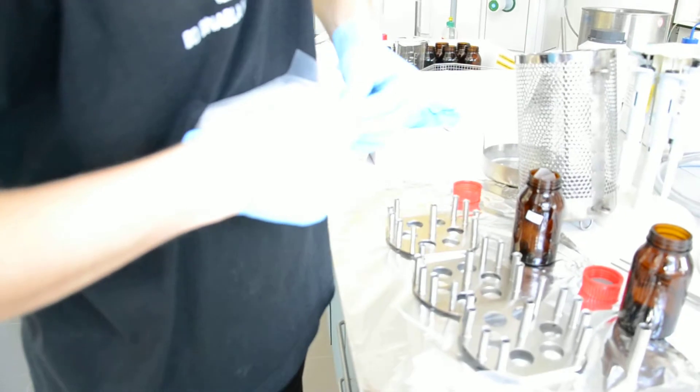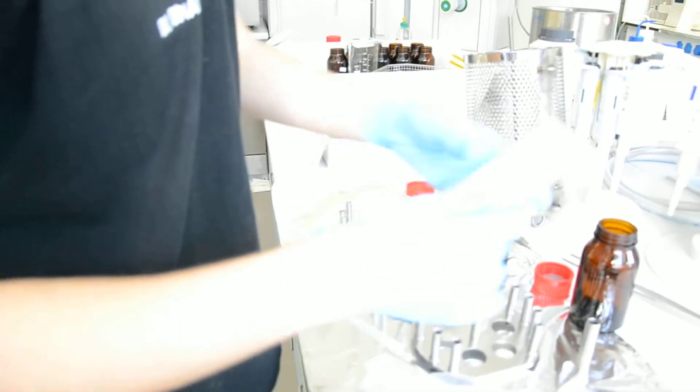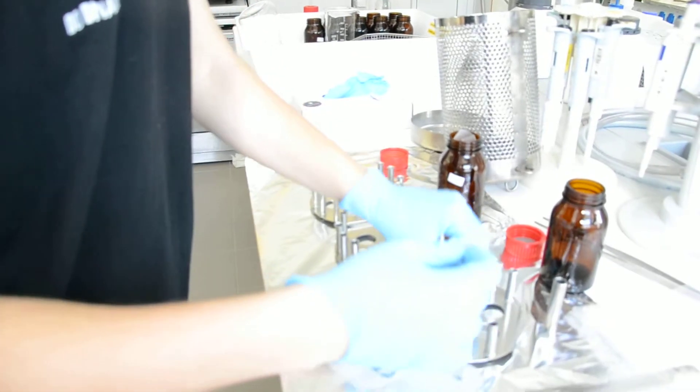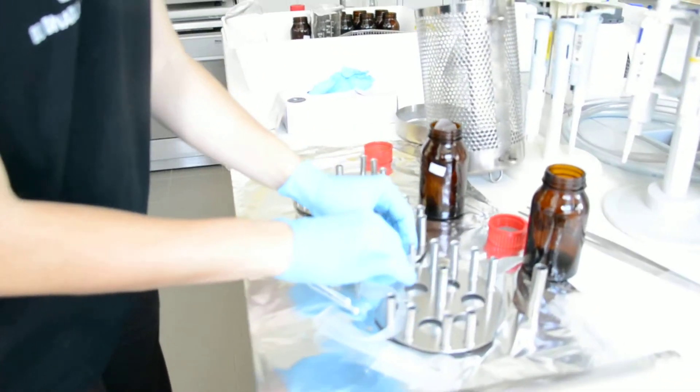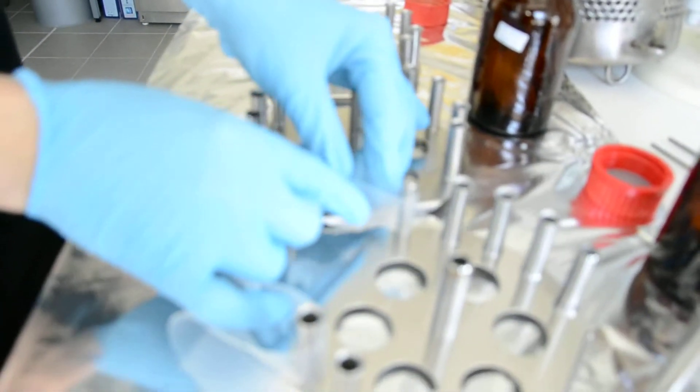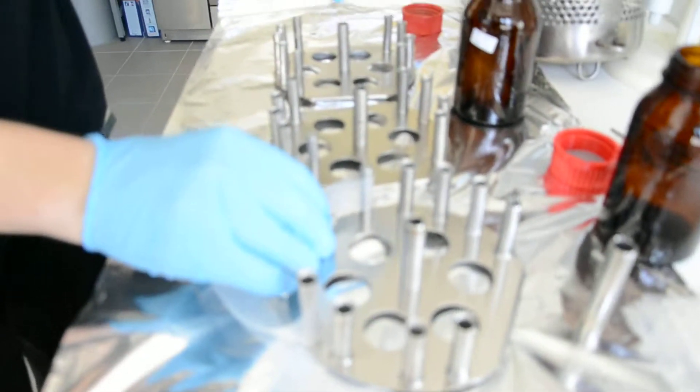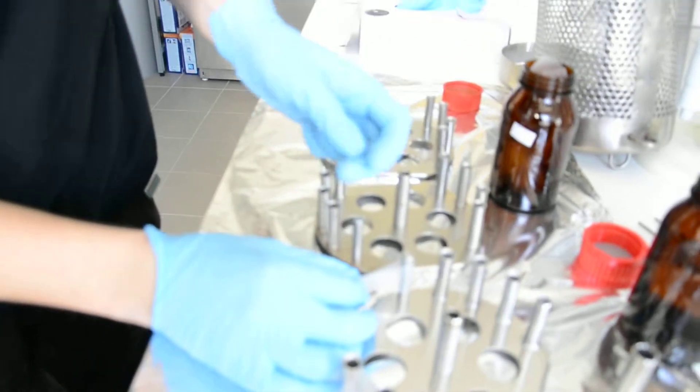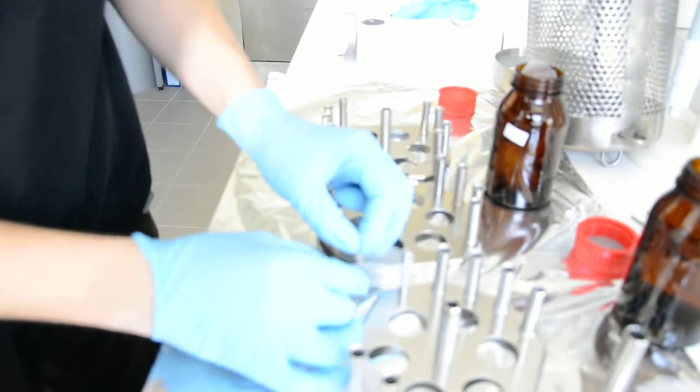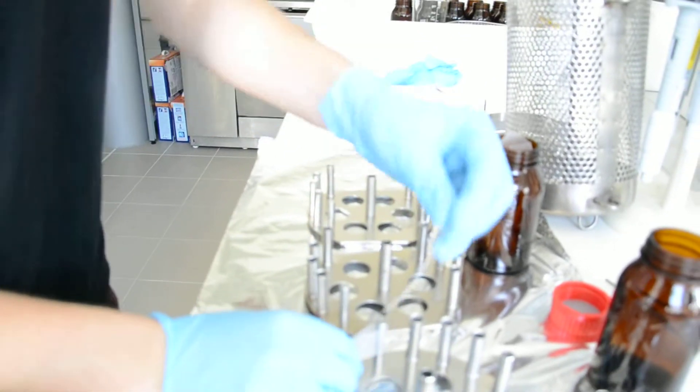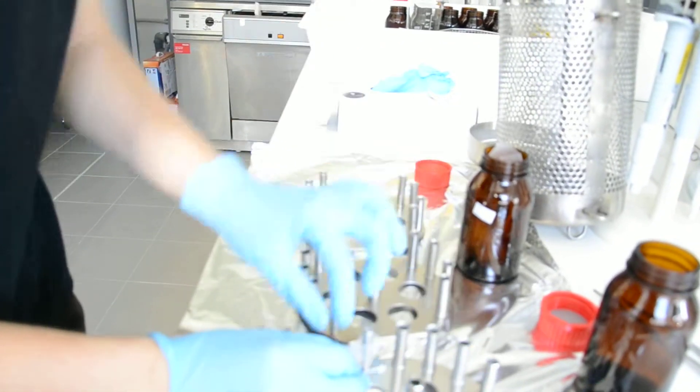First one. The second. Now we can fix it like this. Do it like this. No more than a few centimeter overlap. The overlap is no more than a few centimeters. Just to be able to attach it with the belt.